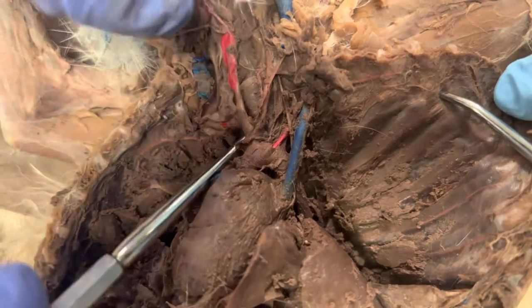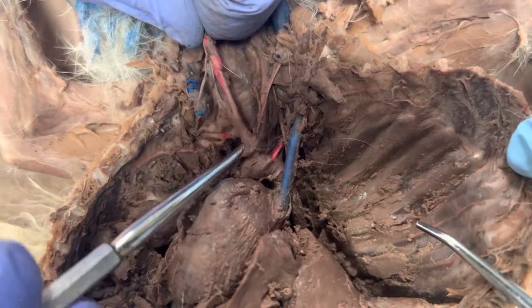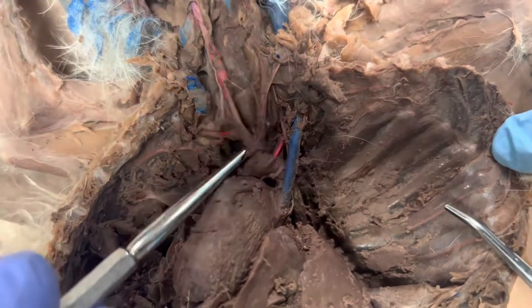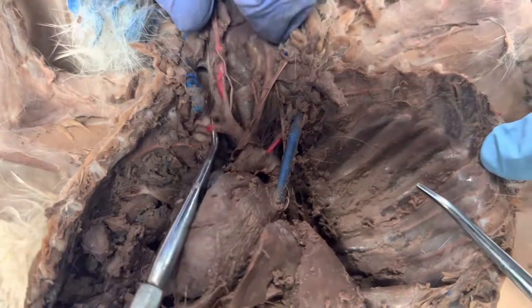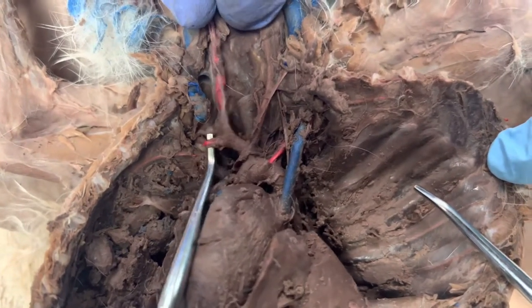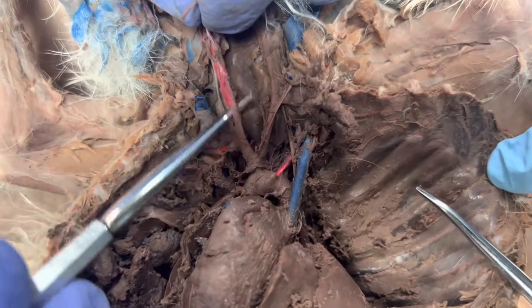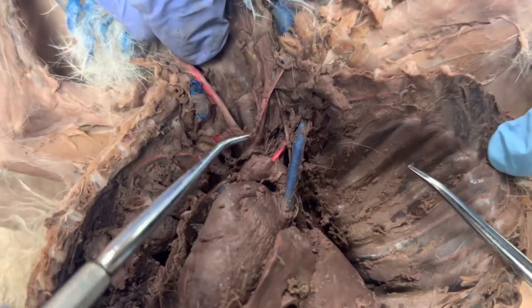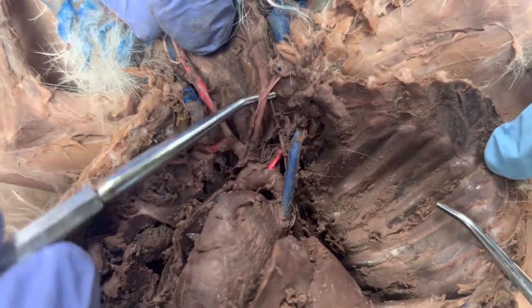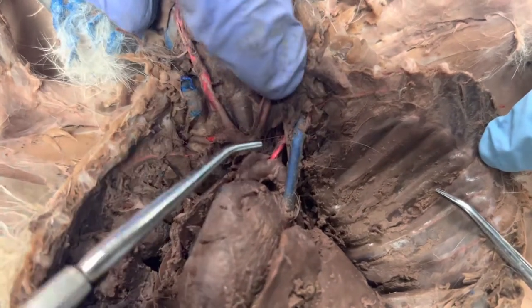Coming off the aortic arch, I'm going to have the brachiocephalic trunk, which is right here. Off the brachiocephalic trunk, I'm going to have my right subclavian artery, which is going to go down into the arm, and I'm going to have my right common carotid artery, which is going to go up into the head. The second branch that comes off my aortic arch is going to be my left common carotid, which goes up into the head.